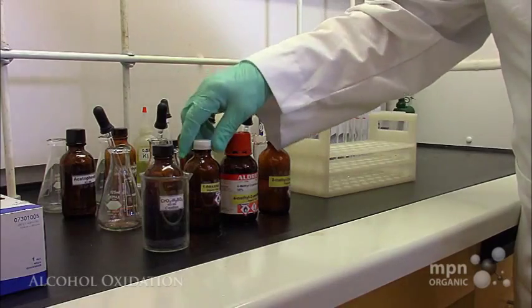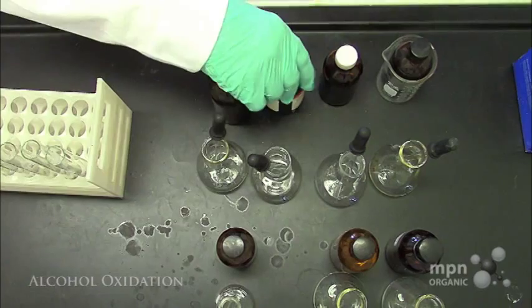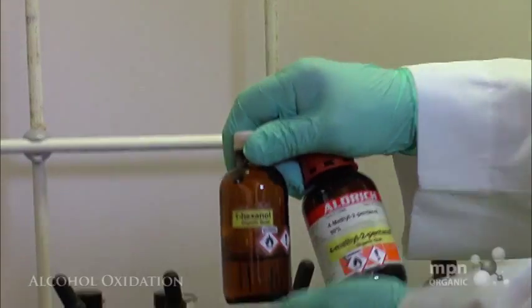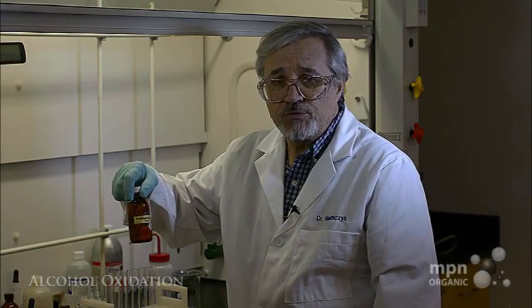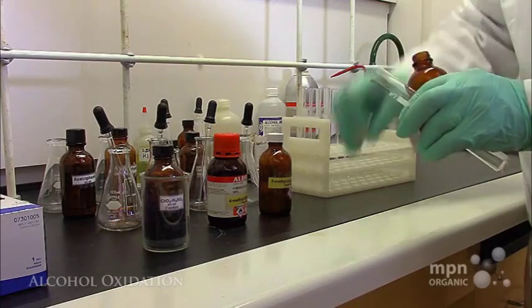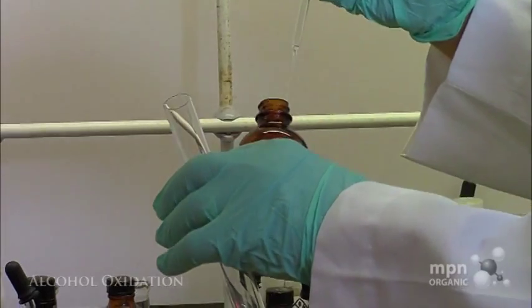So what we're going to do then is to do this test, and this test is designed to distinguish between primary and secondary alcohols, 1-hexanol and 4-methyl-2-pentanol, and the other type, 2-methyl-2-butanol. All right, so let's start out. Let's take some 1-hexanol. Just need a couple of drops of the material.